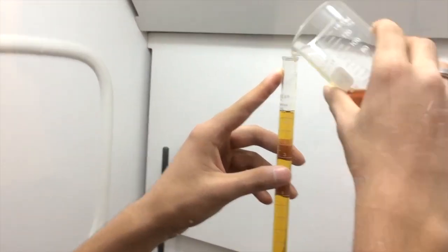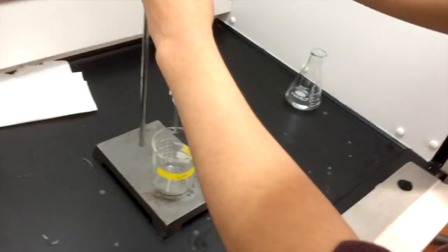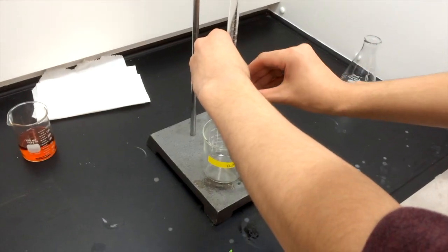It may be useful to fill the burette past the zero marking as you will need to release some of the iodine to remove any trapped air. Record your starting volume.